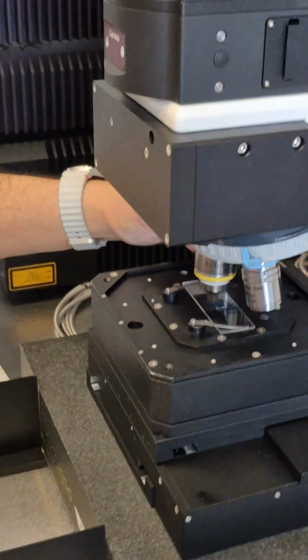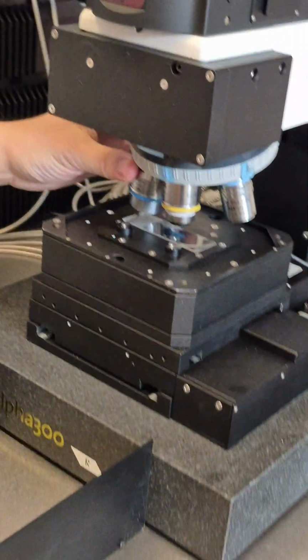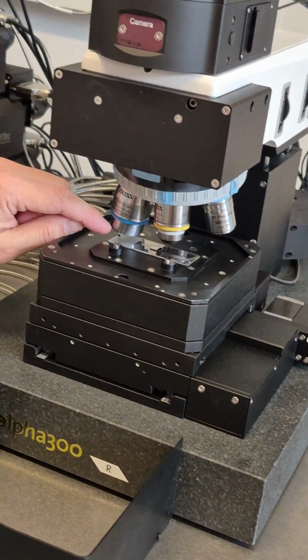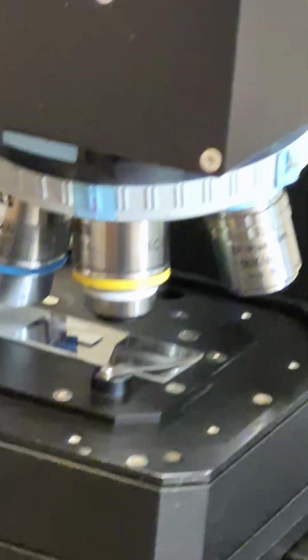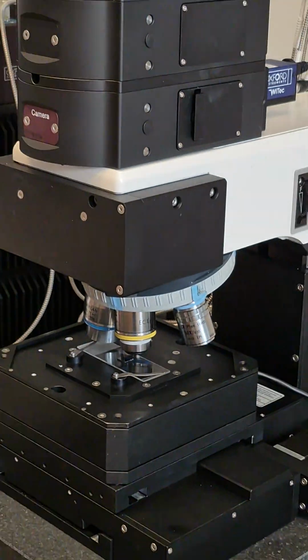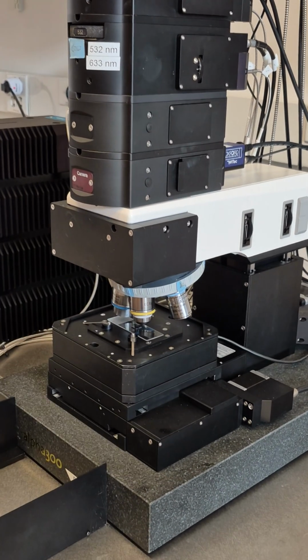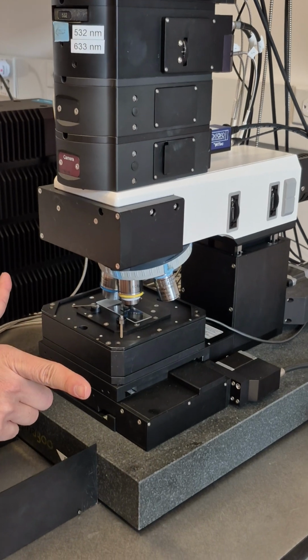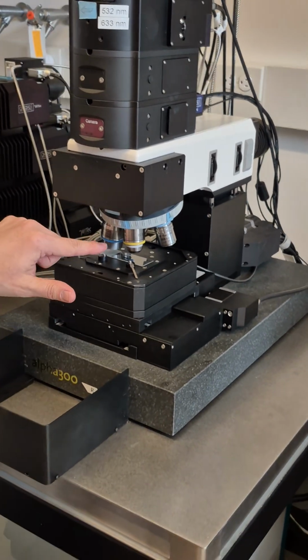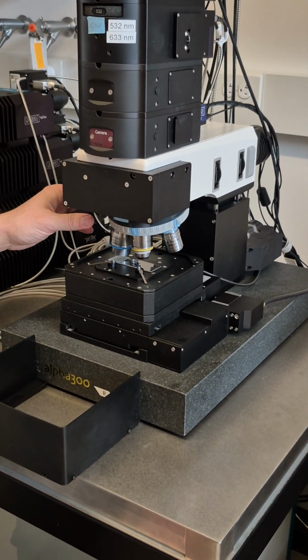In that case, number 1 lens, no problem. But if I move the number 2 in, you see this arm is very close. If you move it inward, it will touch the lens and damage it. So you either choose not to use this, or let it spread outward like this. If you use it, let it spread as far away as possible. So that requires you to put the sample in the center of the glass slide.